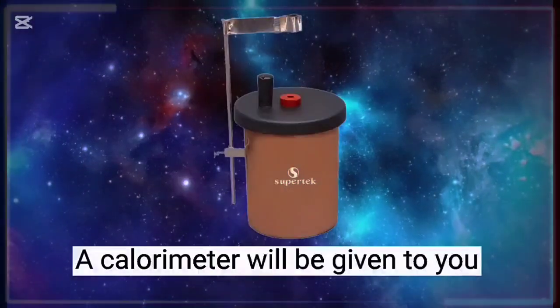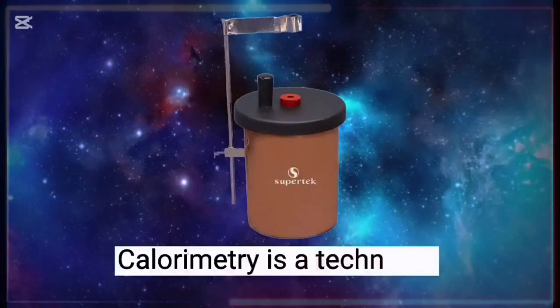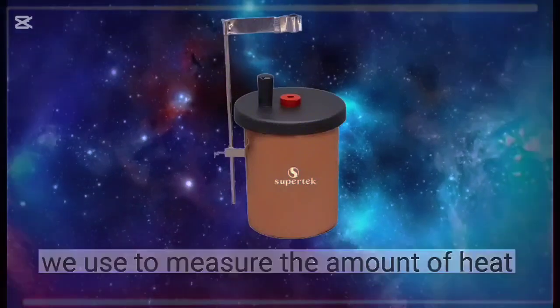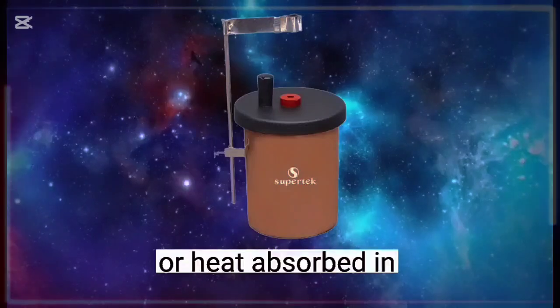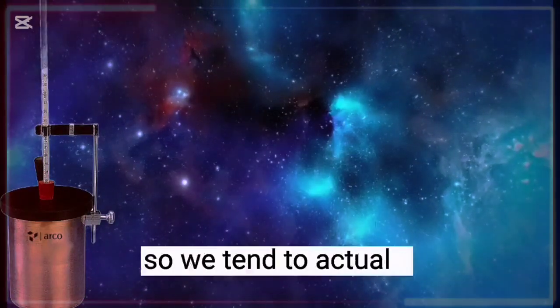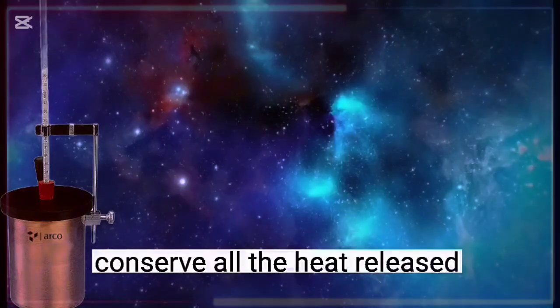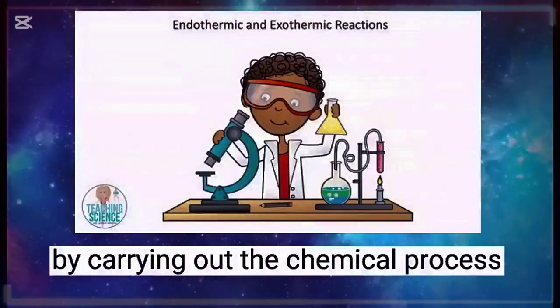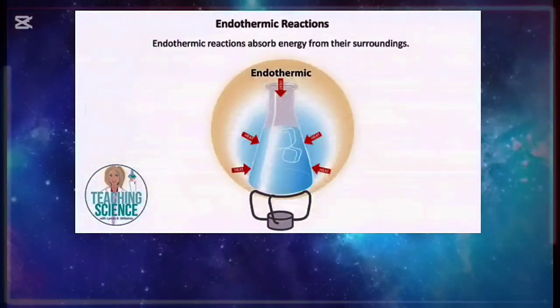Now, a calorimeter will be given to you, and essentially calorimetry is a technique we use to measure the amount of heat evolved, that is given out, or heat absorbed in some chemical processes. So we tend to conserve all the heat released by carrying out the chemical process, the reaction, in the calorimeter, which is the system.